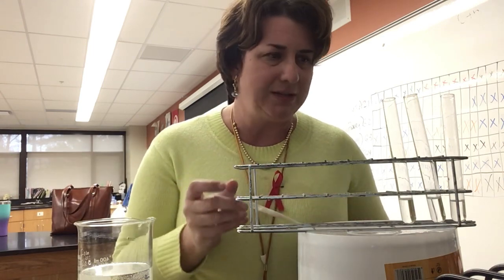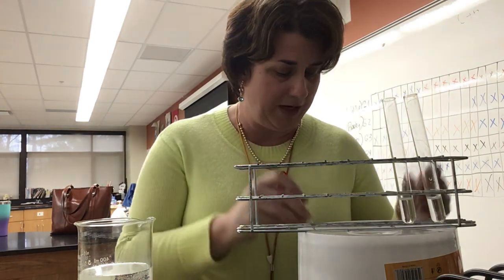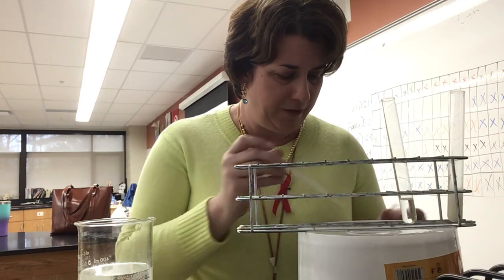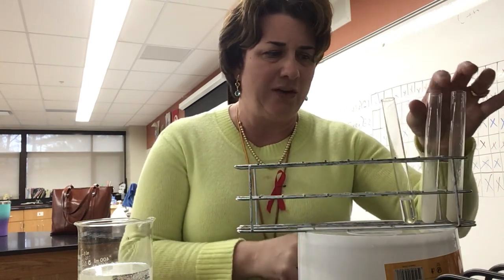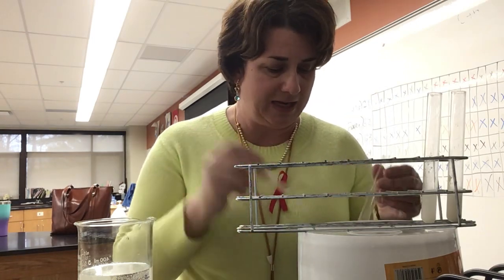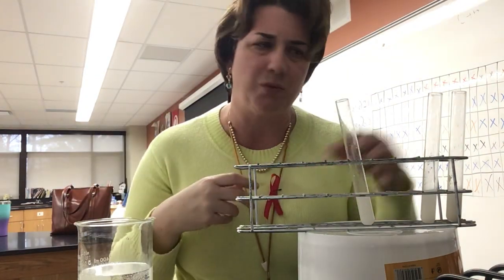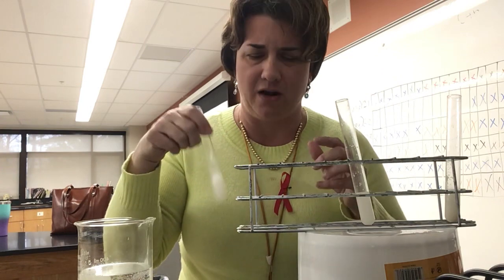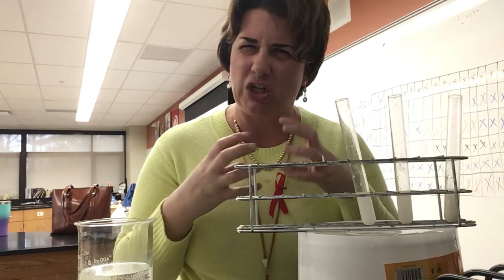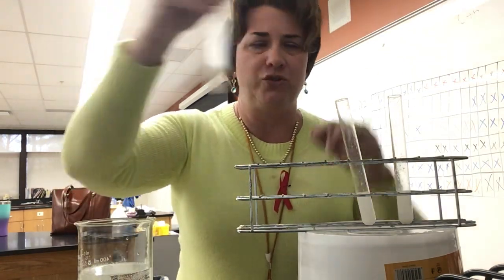So what I do is I've got 3 test tubes here. I've added some water to the bottom of each of them, and to it I'm going to add 1 dropper full of our solution. Roughly, I'm doing 1 part water to 1 part stomach contents, just to make sure that the solutions can mix well enough. If I just put the stomach contents in there, it gets a little too clumpy, and sometimes we can't see everything. So I'm just mixing them up to make sure.